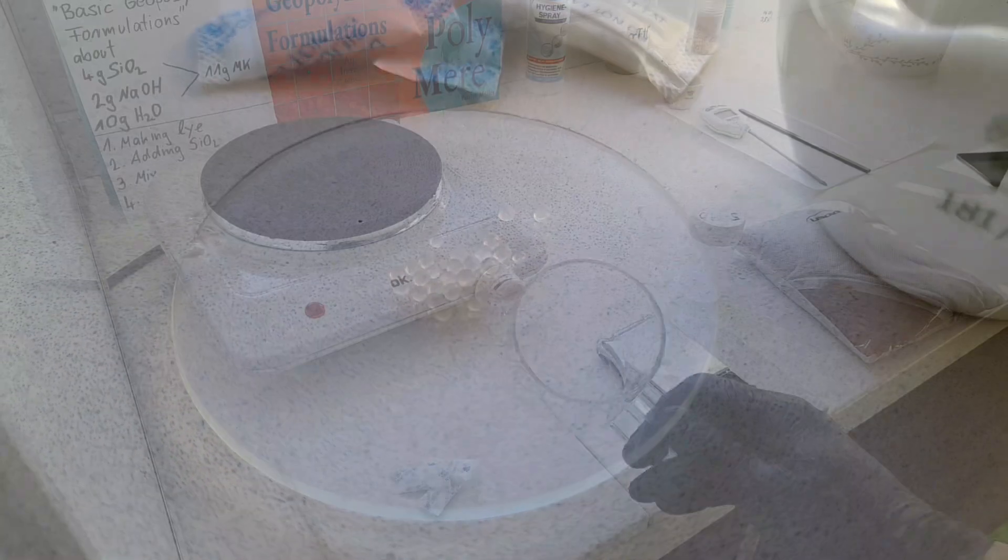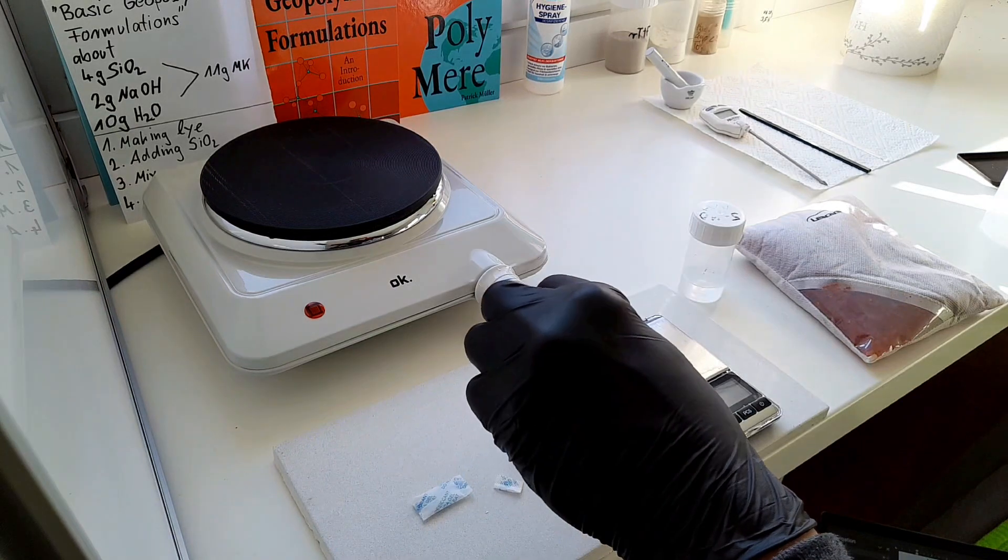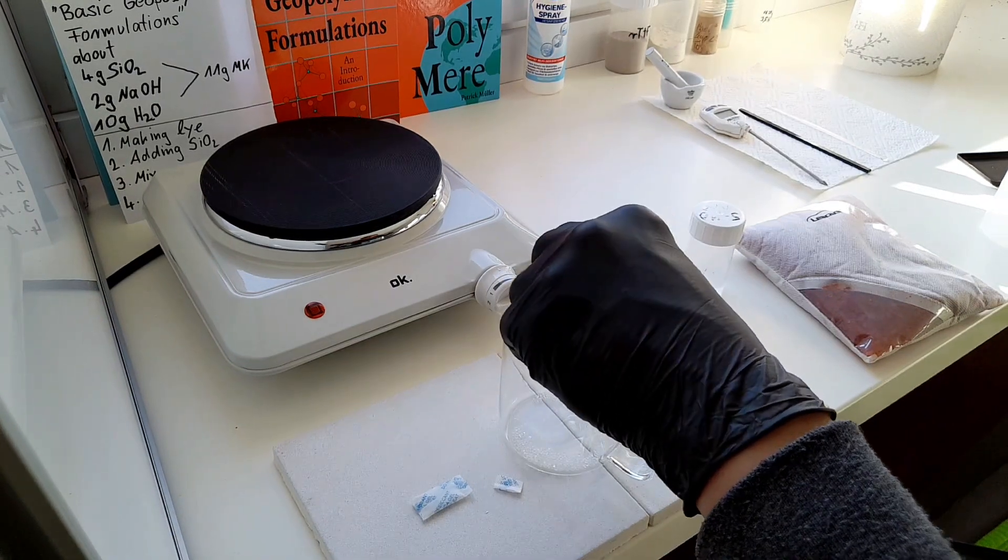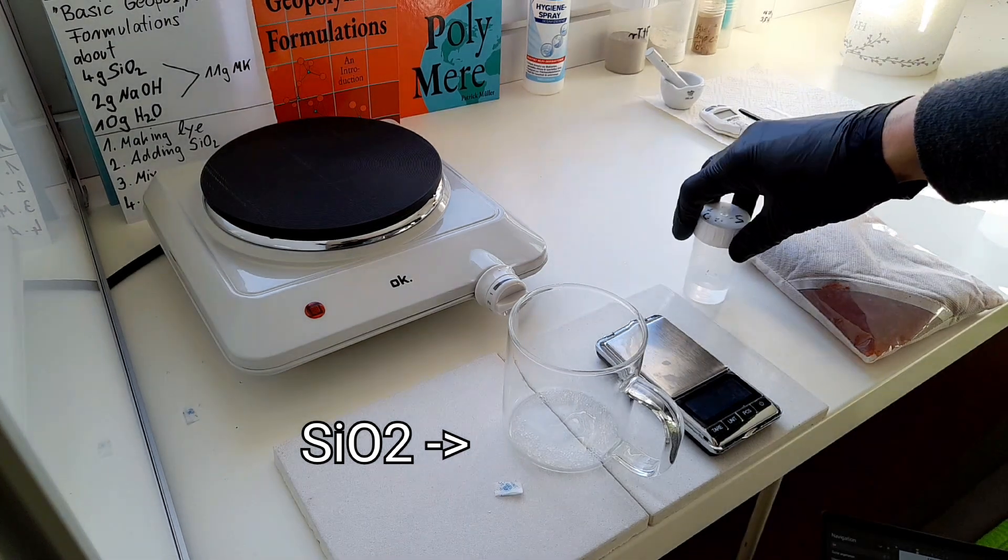Yeah, let's prepare our silica. I already started to open the bags. As you see, they already jumped around. This is 4 grams of SiO2.